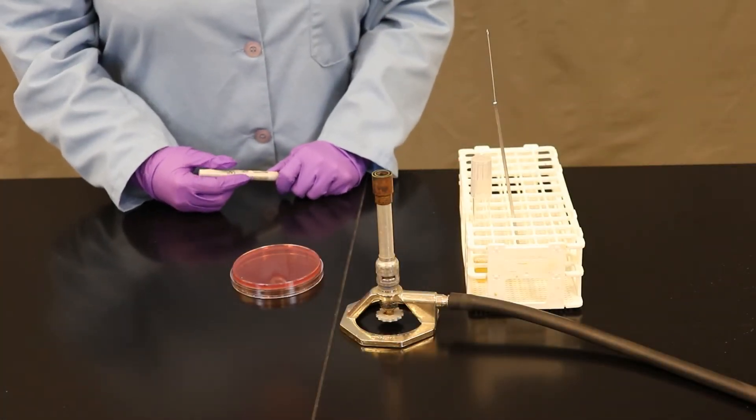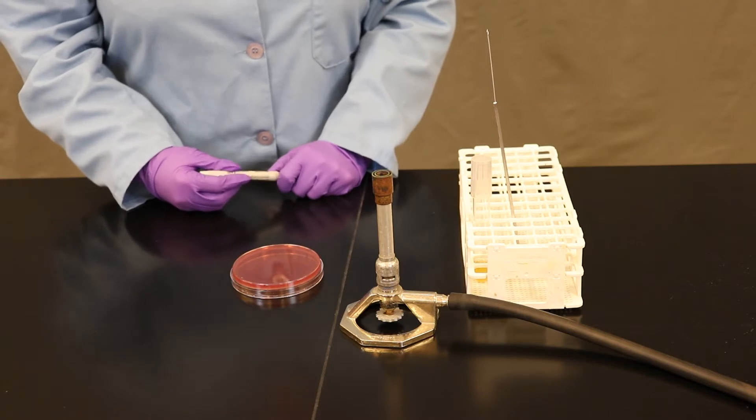Welcome to Bio 205 Microbiology at Pima Community College. In this video we're going to demo how to perform a streak plate inoculation.